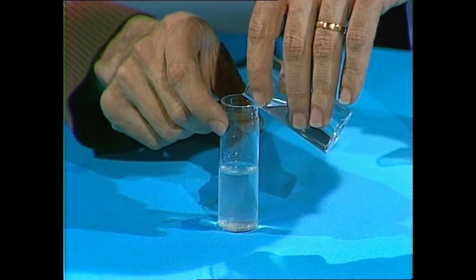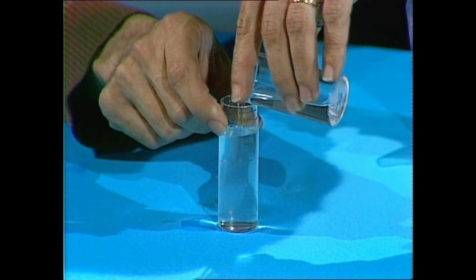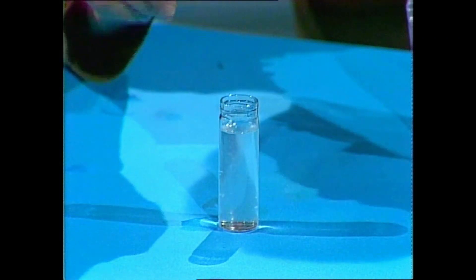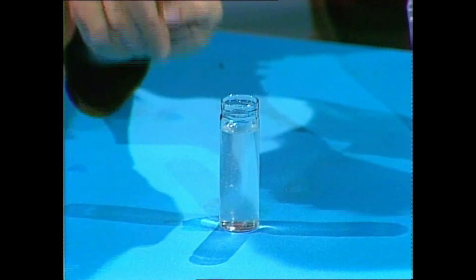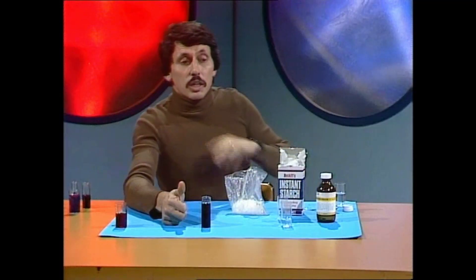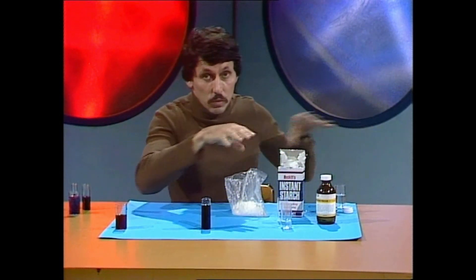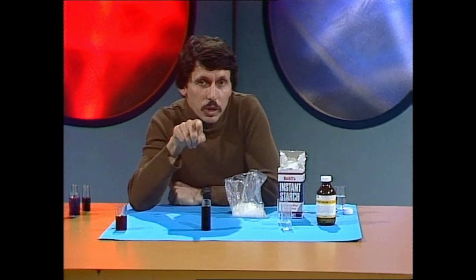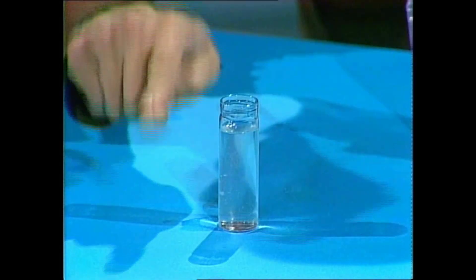This is where the hydrogen peroxide comes in — it's a bit like a bunch of wild dogs rushing into the room to devour the brown paper wrapping, leaving the presents exposed, and the kids seeing them become happy and gleeful — just as the iodine and starch go blue when they finally come into contact. In goes the hydrogen peroxide: 1, 2, 3, 4, 5, 6, 7... You can adjust the rate of your time reaction by altering the strengths of your solutions, and particularly how much hypo you put in when you make the iodine change to colorless iodide.